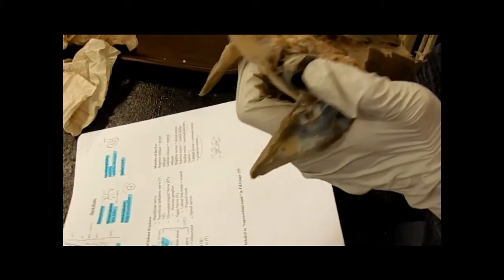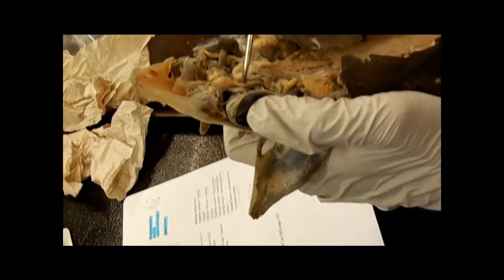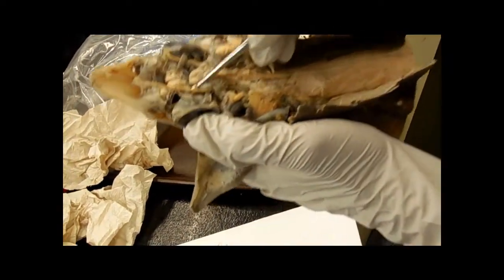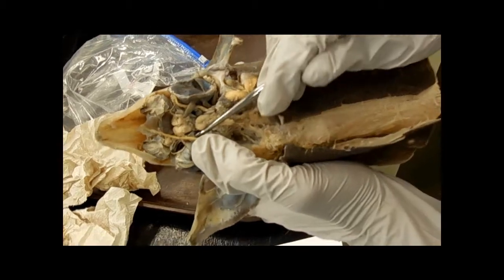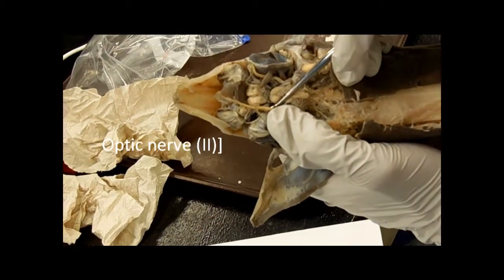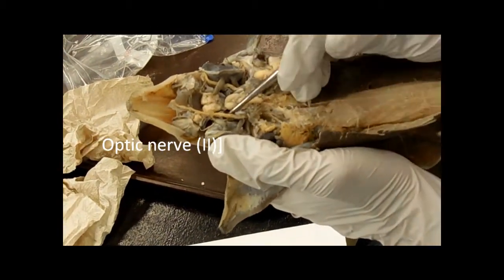So tucked away amongst all the muscles, there's no easy way to get to it. This guy, it's slightly lighter than all the other muscles. I don't know if you can see it that well. This is the optic nerve. It makes sense because it goes right to the eye.